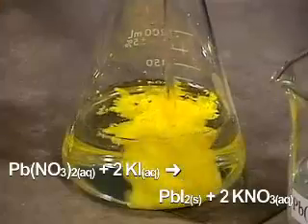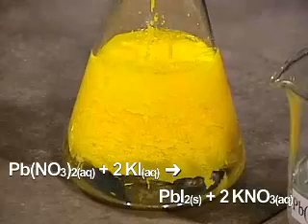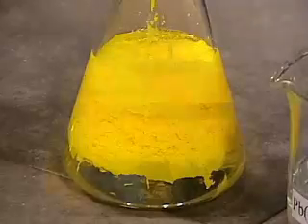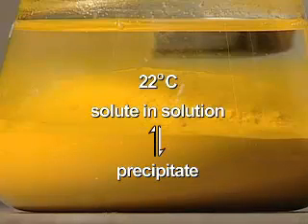What happens? How soluble is lead-2 iodide in water at room temperature? With time, the precipitate settles. A dynamic equilibrium is established between the dissolved solute and the precipitate.